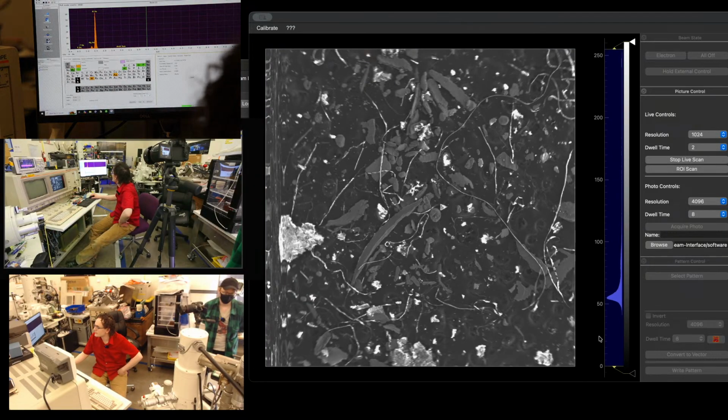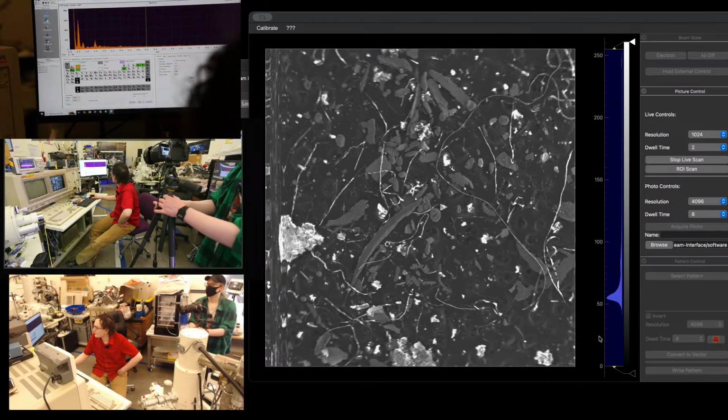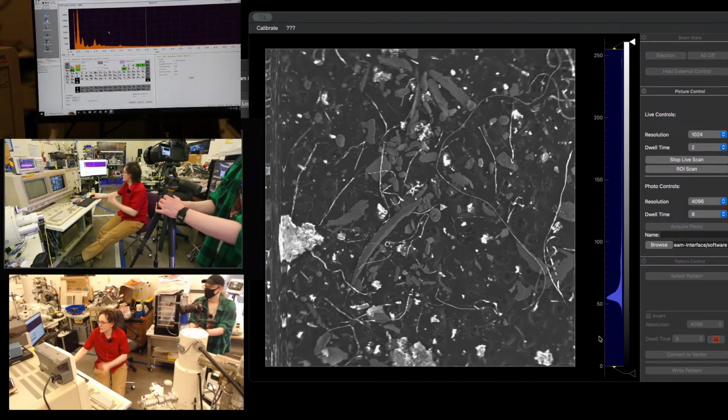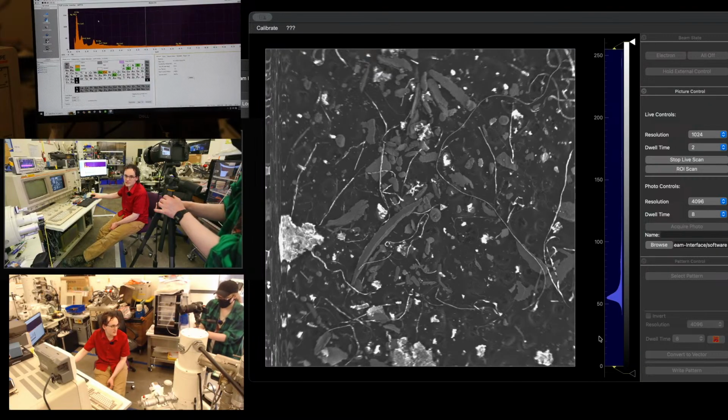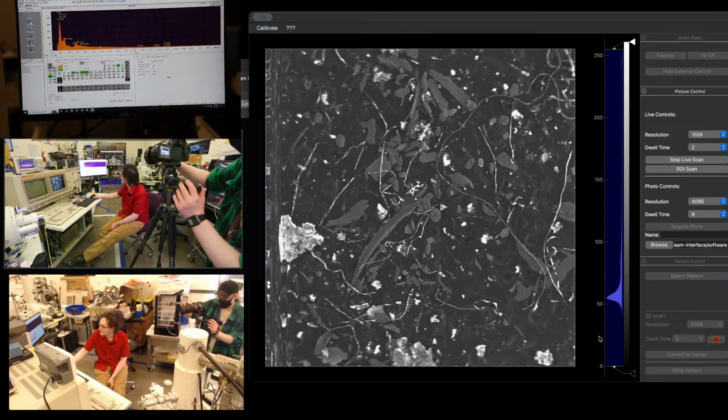So that's our third, so that's spectrum 3. So let's do spectrum 4 now. 50 millimeter working distance, all good. Okay, so now we're getting a spectrum off of the whole stub. So anything that's on this stub is going to be generating signal. Expect to see a lot of carbon, a lot of oxygen, because that's what the carbon tape is made out of. So we got our big old oxygen peak there.